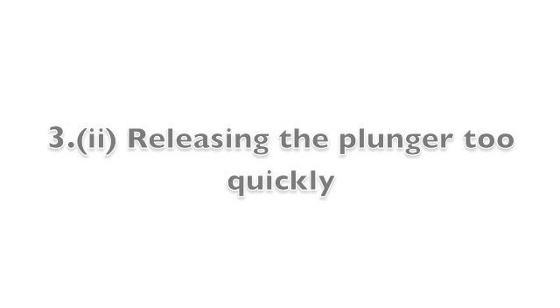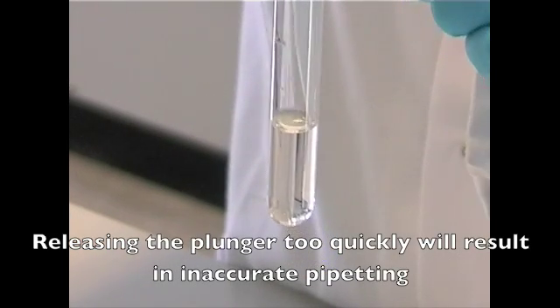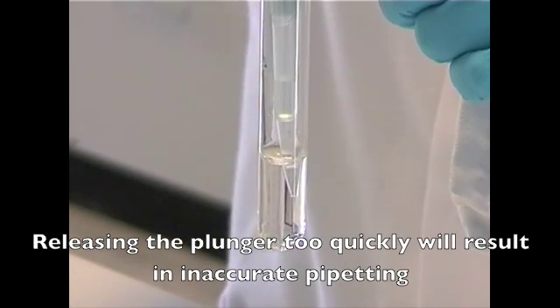Releasing the plunger too quickly will result in inaccurate pipetting and may cause liquid to be drawn into the barrel of the pipette, which may then have to be repaired.